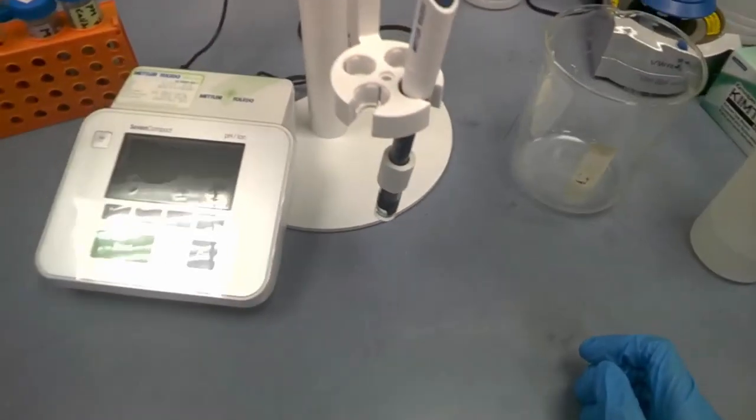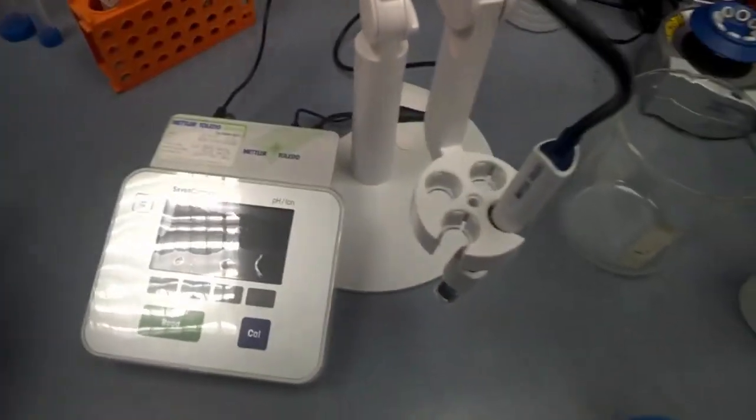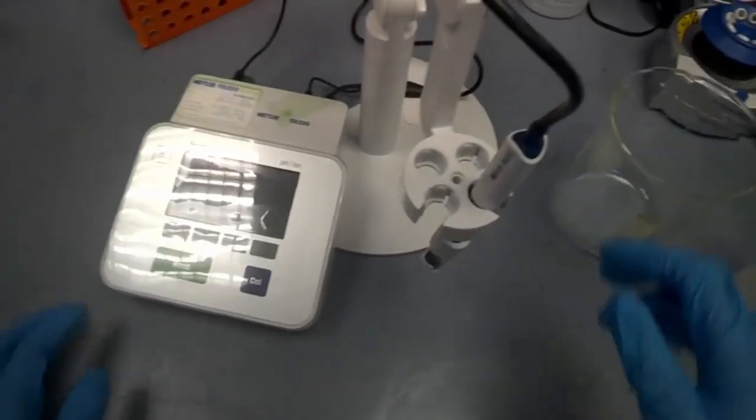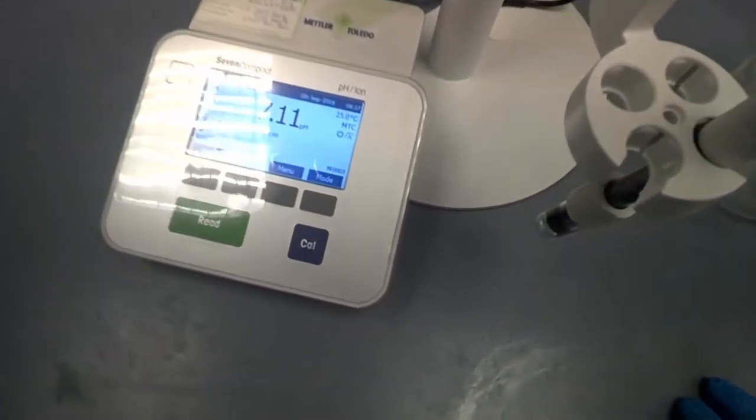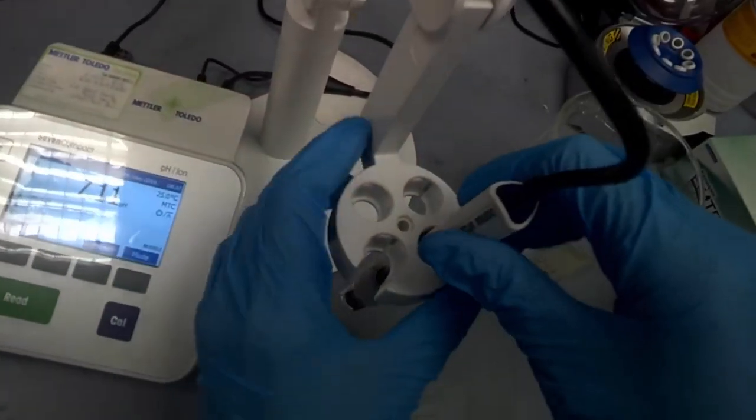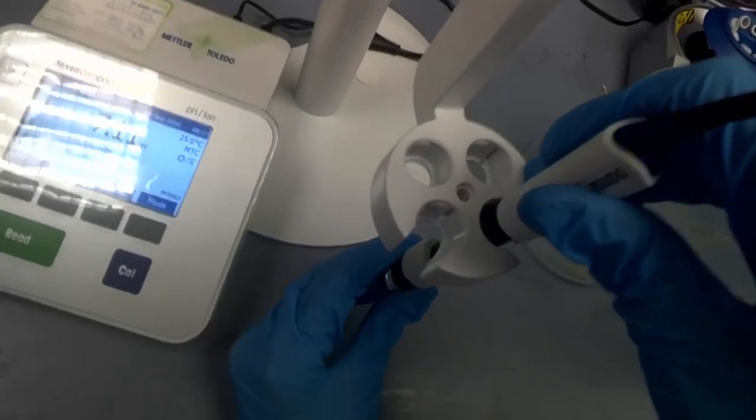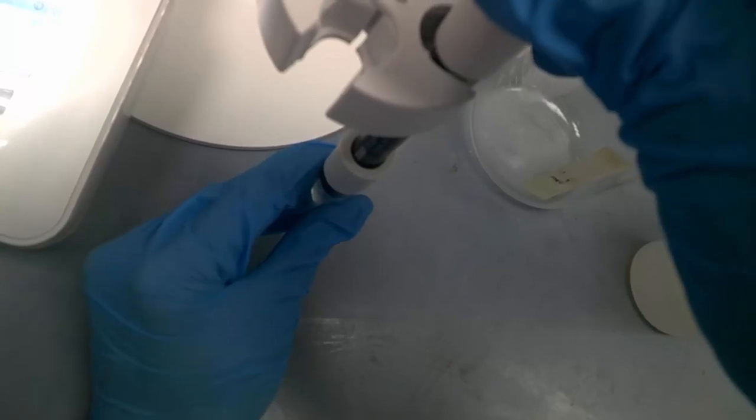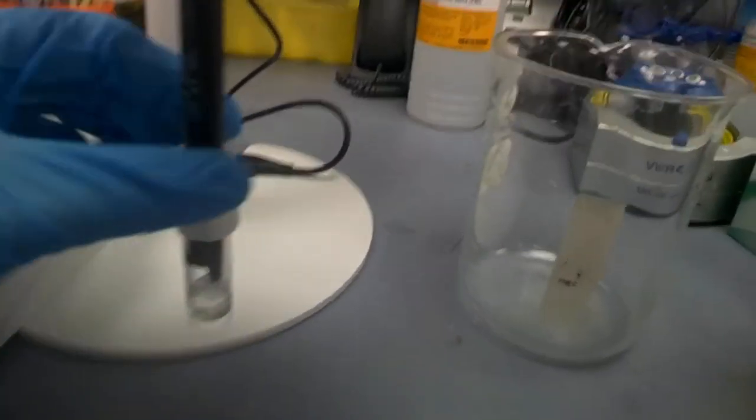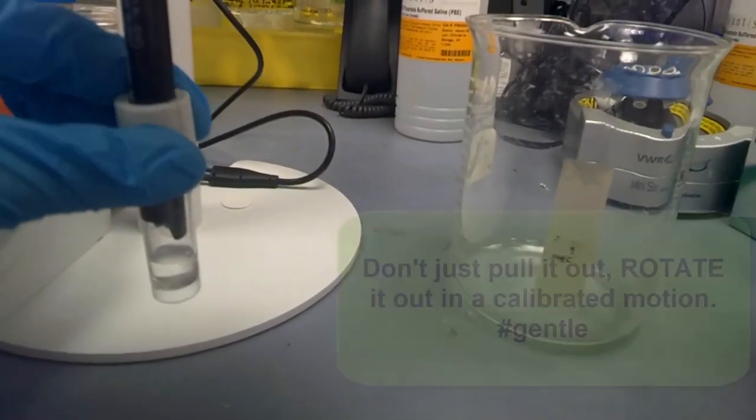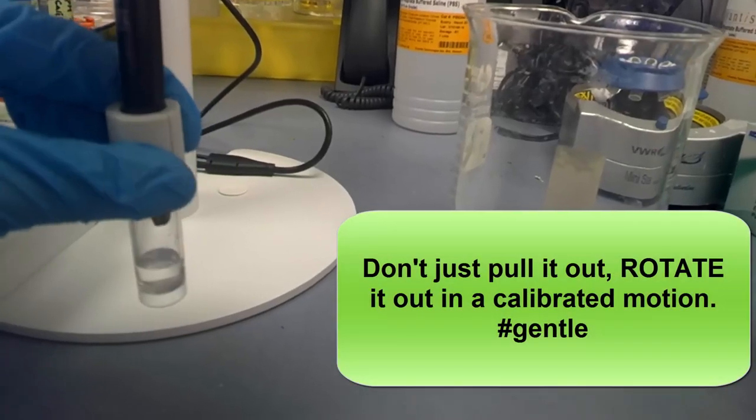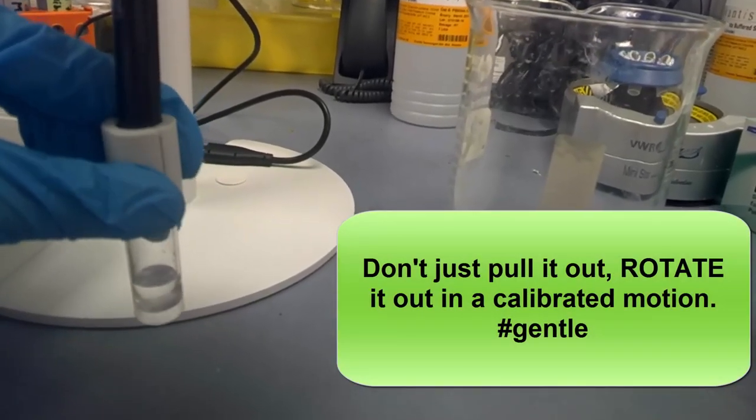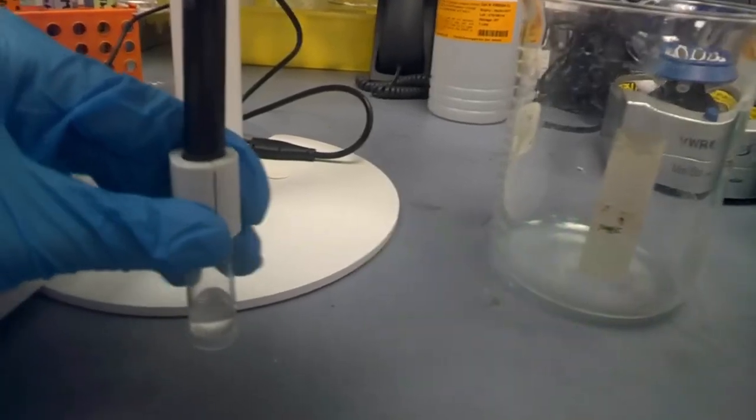Before you do any instrumentation measurement for your sample, we need to do calibration. Press and turn on, you see it's already on. Now take out this casing slowly, just rotate out, be very gentle. This is quite fragile, so rotate out.